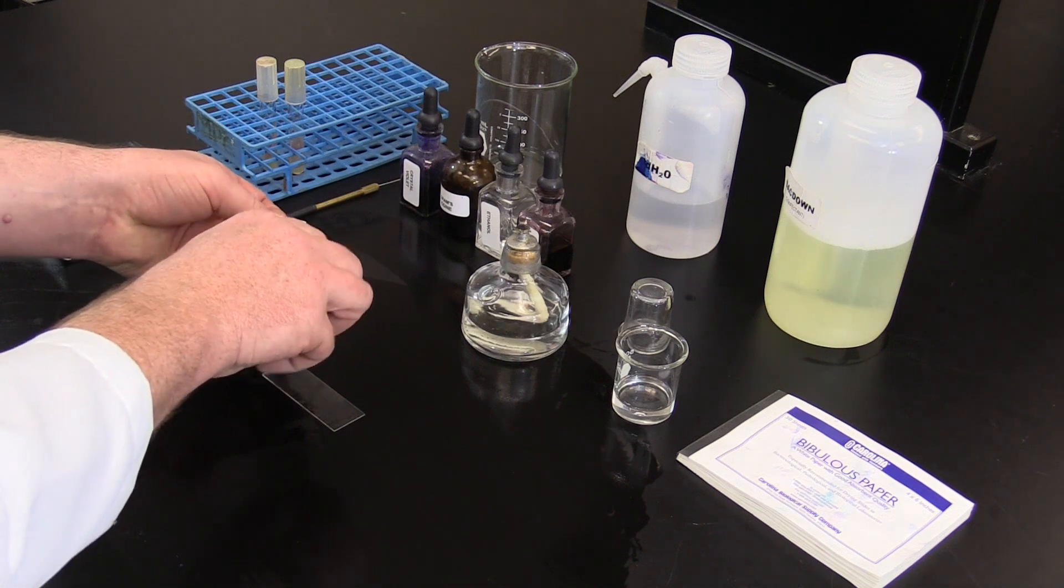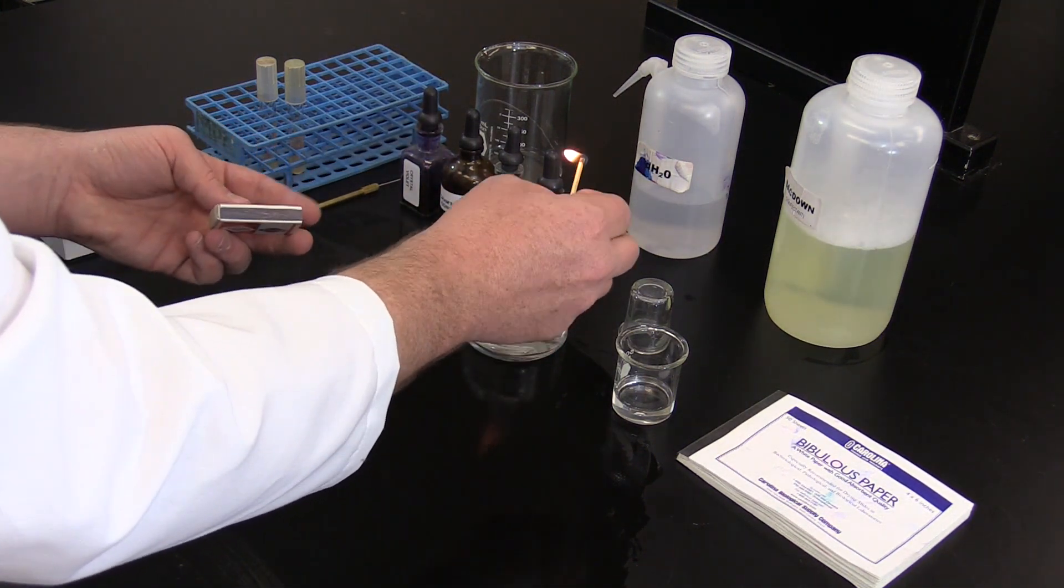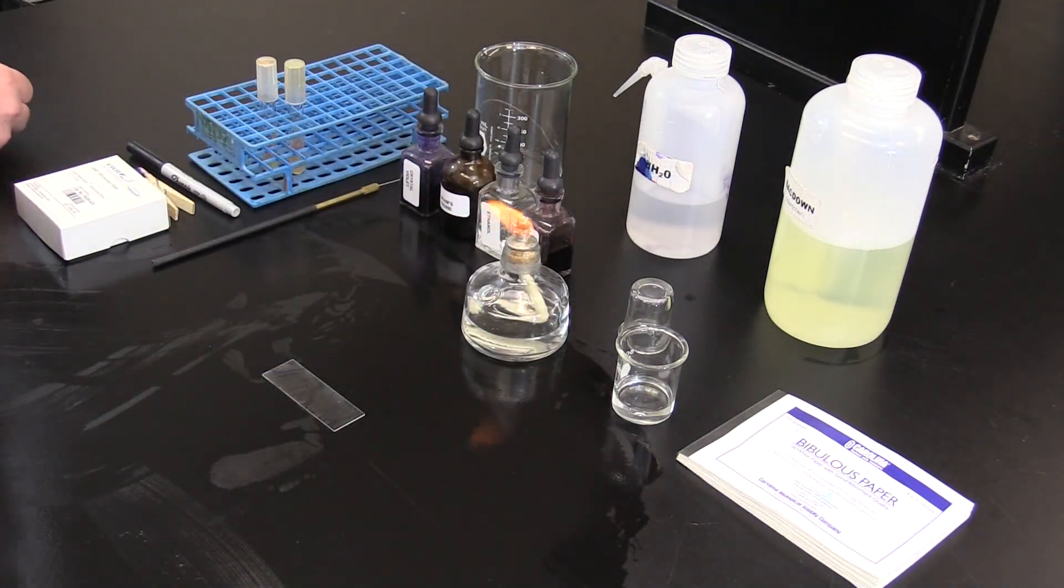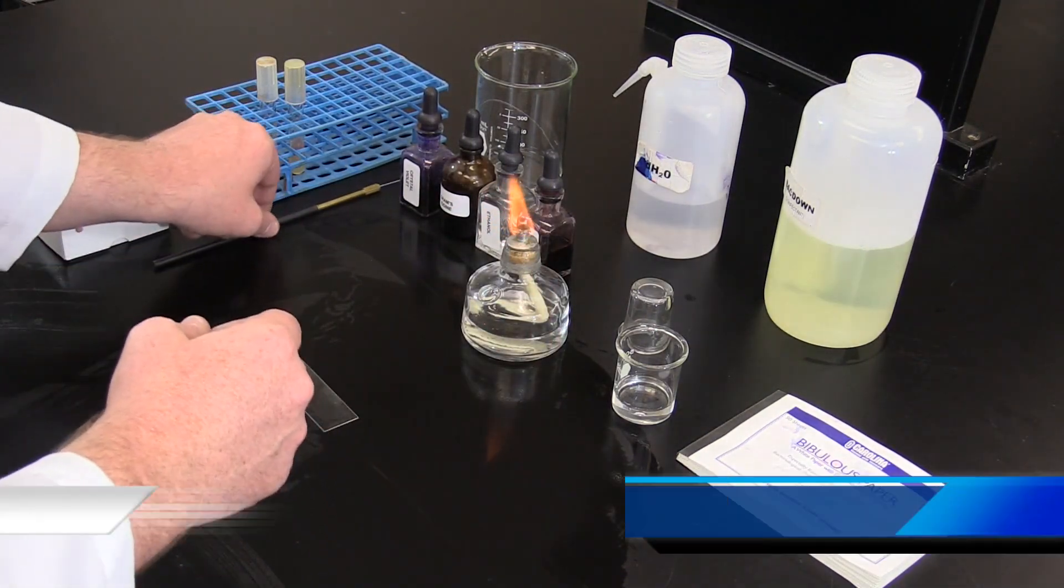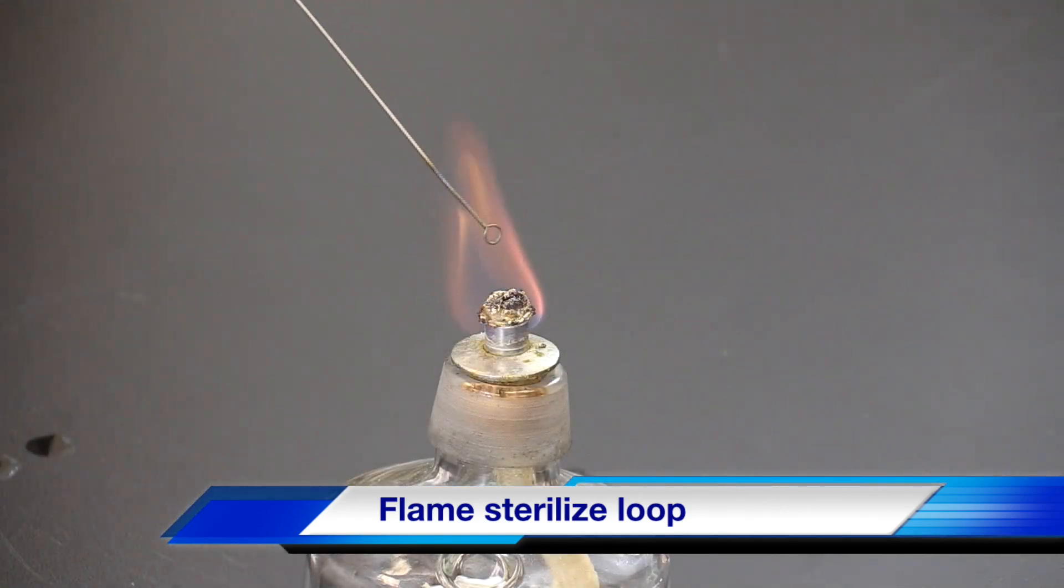Using a match, light the alcohol lamp. Place the tip of the loop into the flame until it glows red.